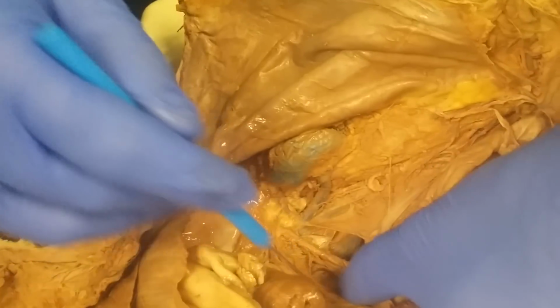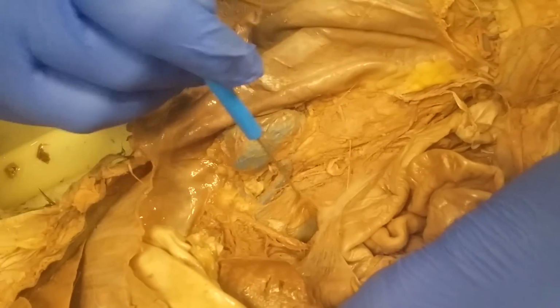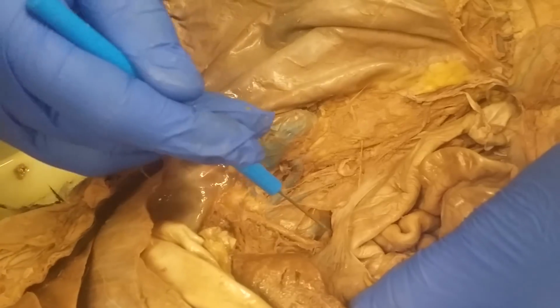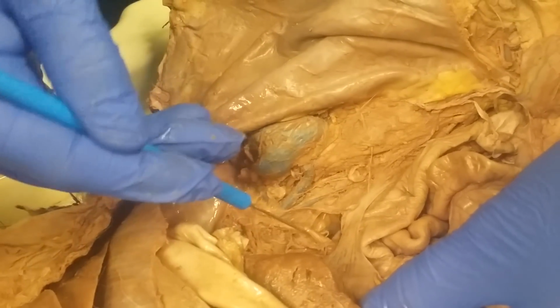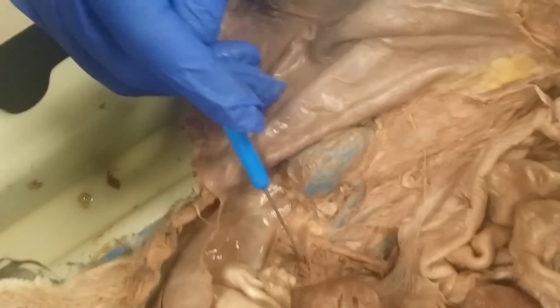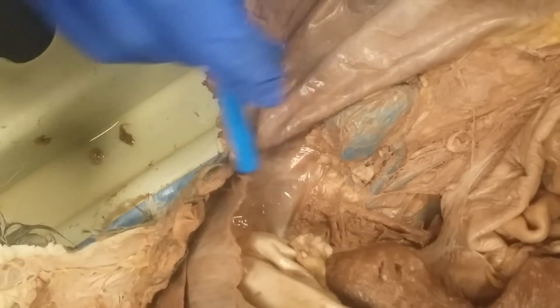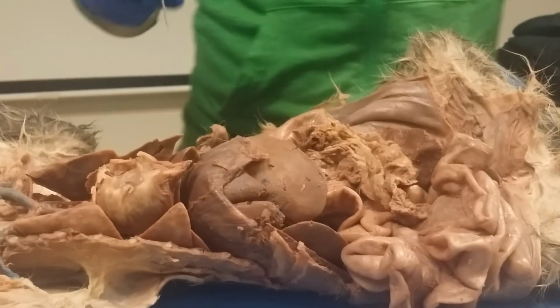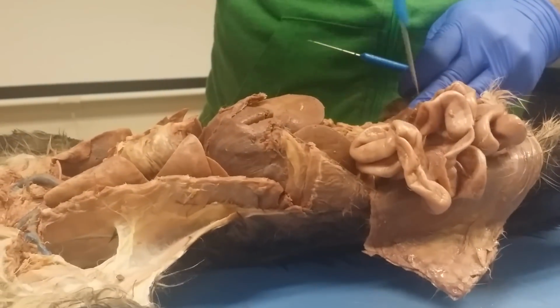Sometimes on like the descending aorta, you might be able to find, like right here, this is going to be the inferior mesenteric artery, because you know that's the one that goes to the descending colon, because the inferior mesenteric artery is the one that gets pooped on. Then the superior mesenteric artery would be right above that. The celiac trunk, I don't think you'd see in this cat, but it'd be more superior to that, which would be up in here, which go send stuff to the stomach and stuff, but you can't really see. The gastric artery is too low, but just know those three, like celiac trunk, superior mesenteric, inferior mesenteric, just in case you see it on the descending aorta.